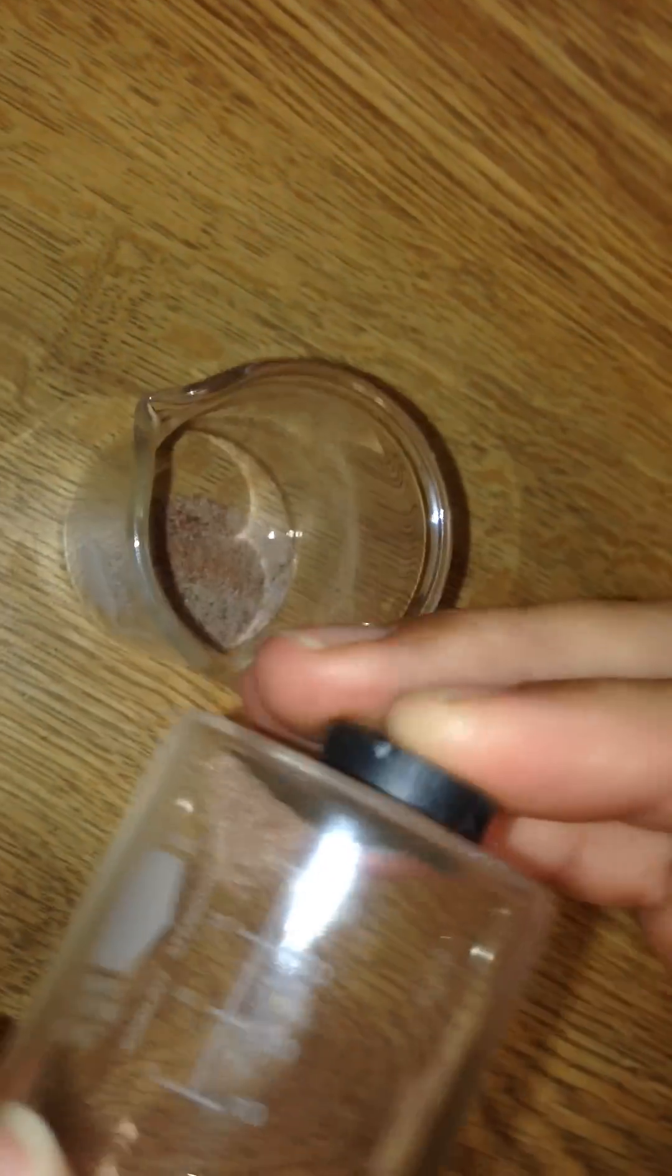And then you could go back if you want to get greedy and get some more. And do the exact same procedure until all of the iron filings are out of your mixture.